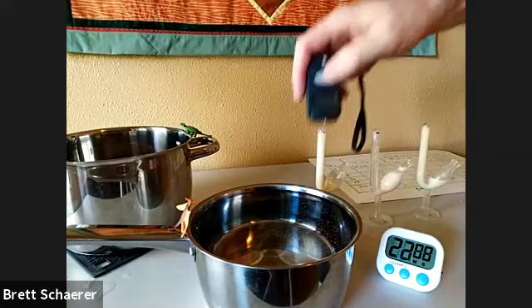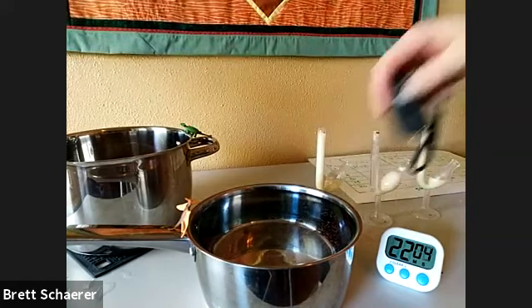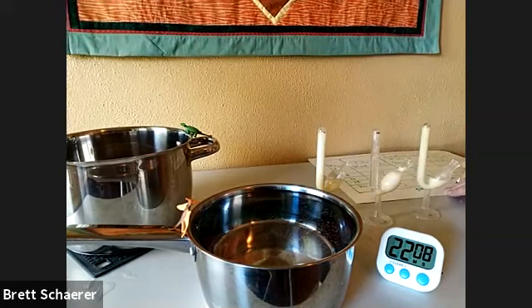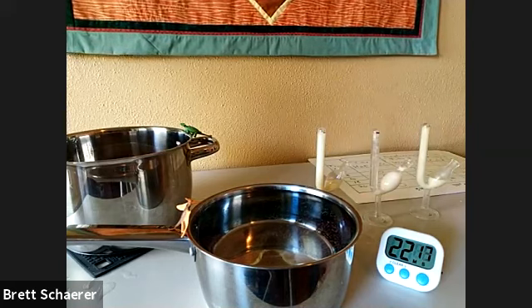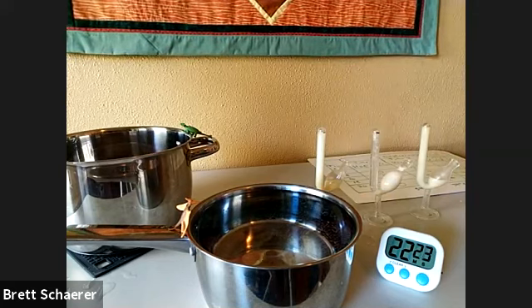The warm environment is now at 34 degrees. And in the cold environment, it is still at 4 degrees. Well, actually, it's a little colder now, 4.4. So we're going to round that off to 4 degrees.